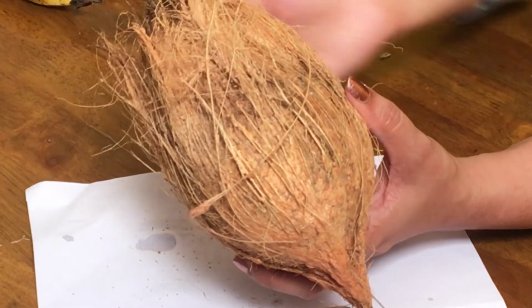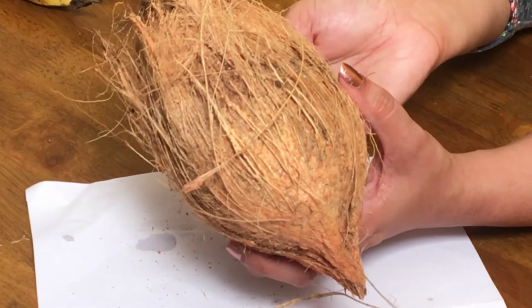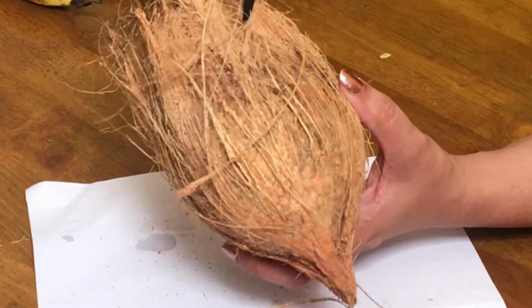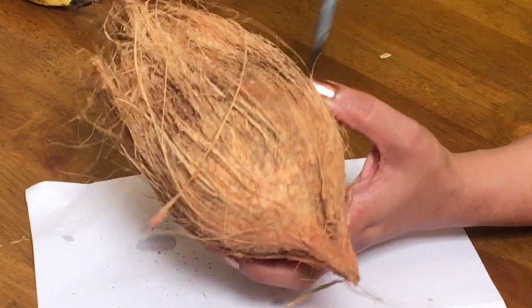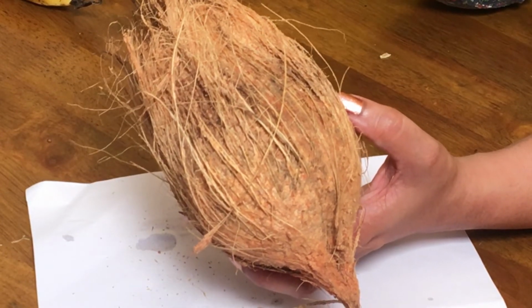And the outer part of coconut, generally if it's a young coconut, will be green in color. That outer green part is the epicarp. This fibrous part is the mesocarp, and this hard shell is the endocarp, and inside you will be able to find the seed. Even this is also a simple fruit because this is also formed from a single ovary.